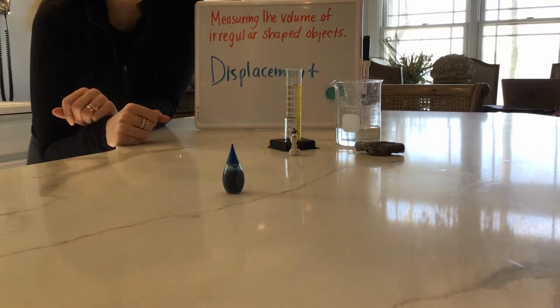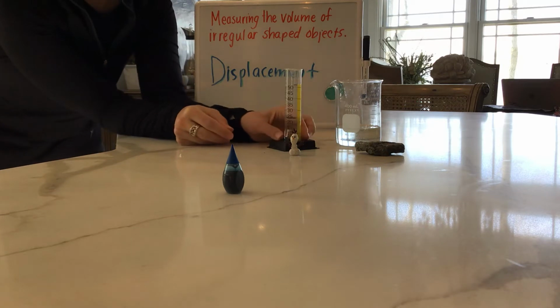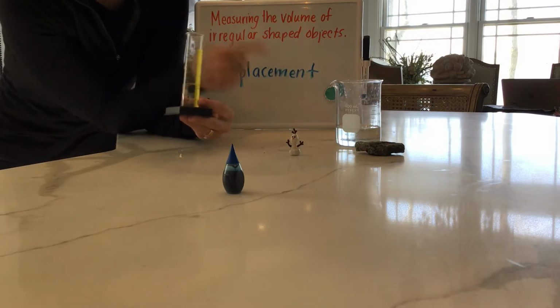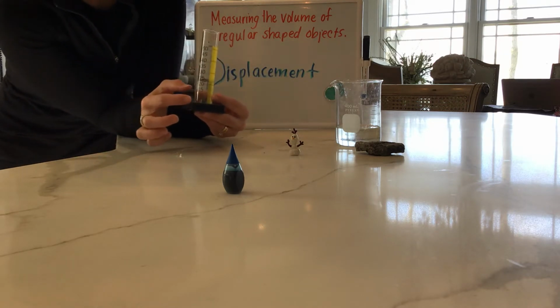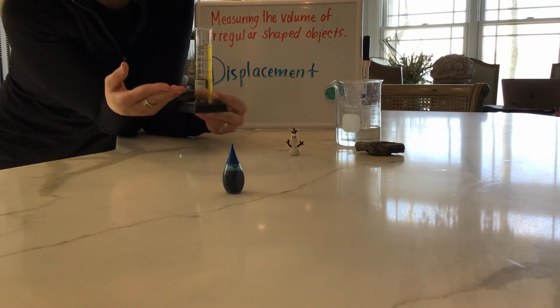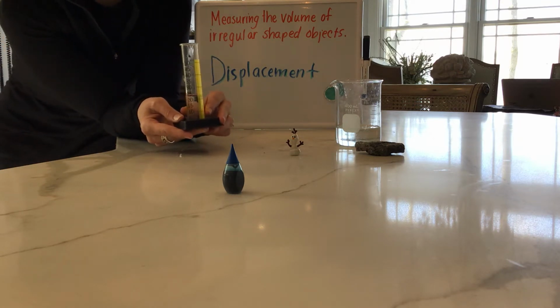Good morning, students. So today we're going to do a really quick follow-up lesson to what we've been learning about measuring liquids using a graduated cylinder or a beaker. Now, the unit that you use when you measure with these is usually milliliters, because in science class you're usually measuring small amounts of liquids. So we use the metric unit of milliliters.